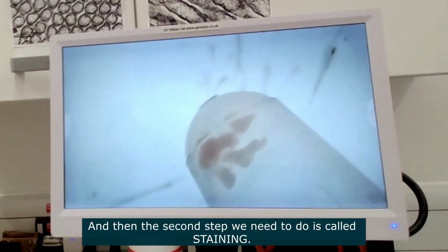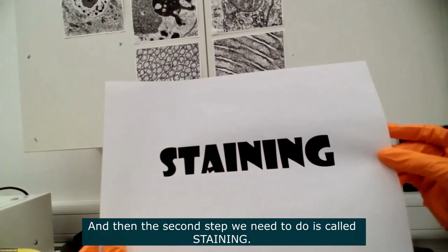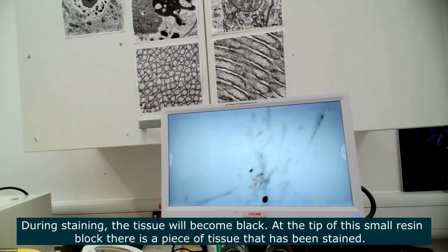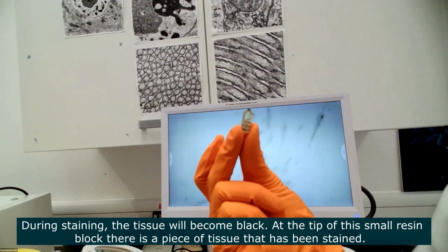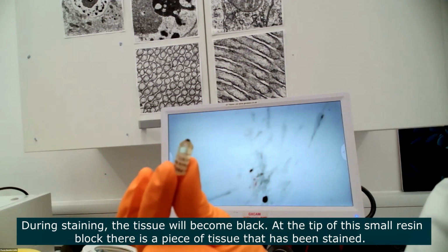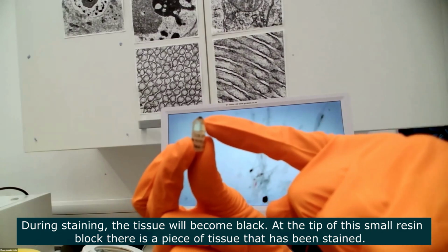And then the second step we have to do after we fix the tissue is a step of staining. Yeah, it's called staining. During staining, the tissue will become black. So in this block here, this is a little resin block, and at the tip of the resin block, we have a piece of tissue that has been stained.